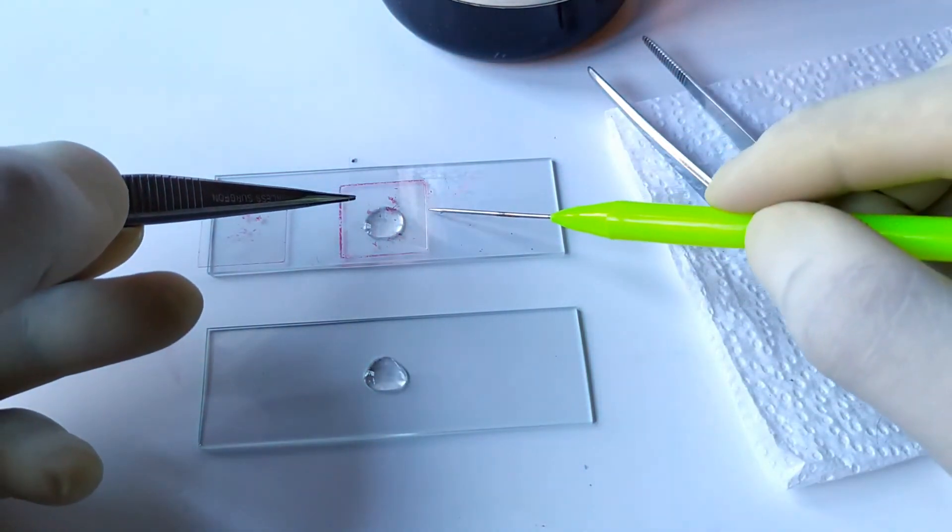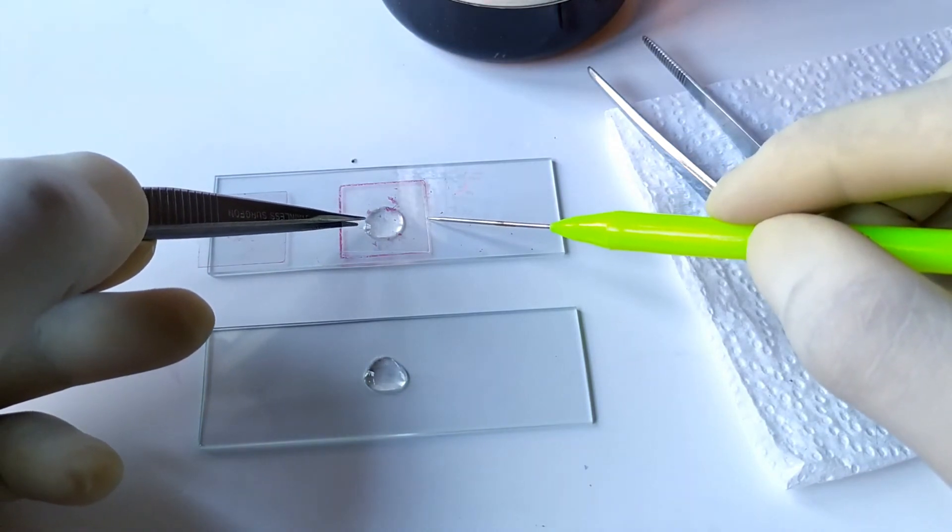Gently lower a clean cover slip onto the mounting medium in the slide containing the cell materials.